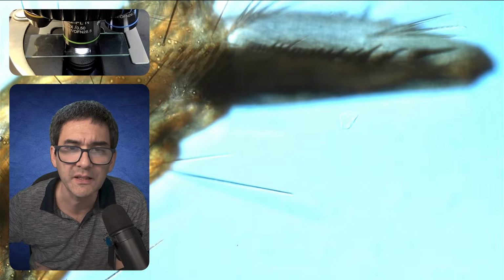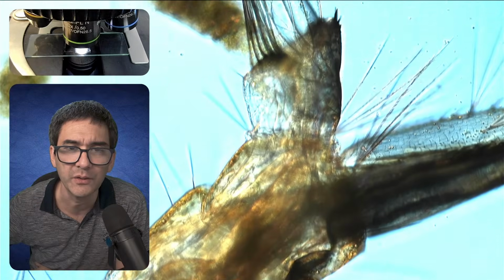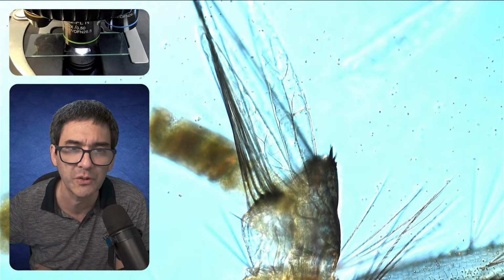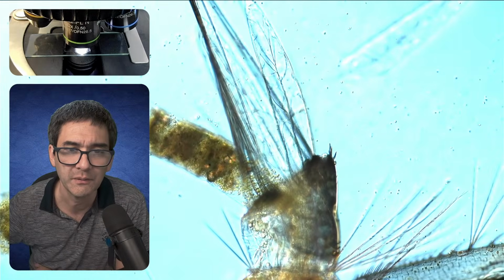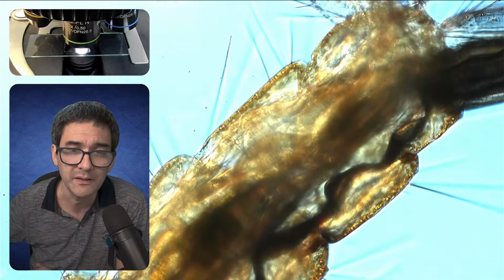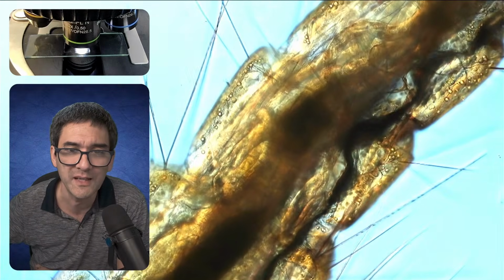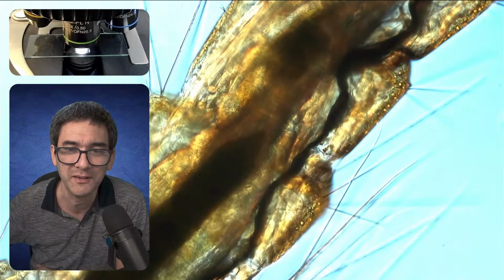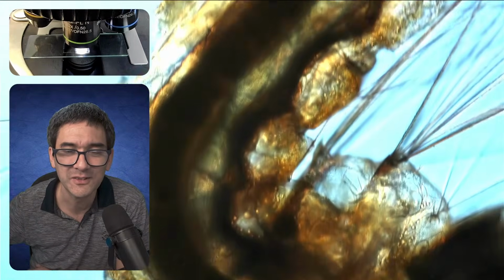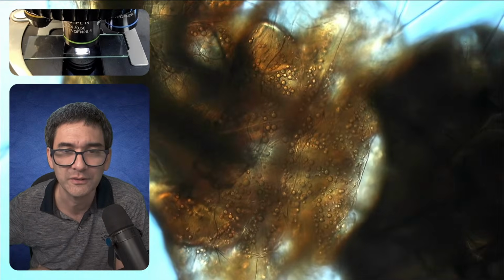To a certain extent, I know that these are not always very nice animals, nice under quotation marks, because they cause so many problems, at least if they are indeed mosquitoes. But in any case, I think under the microscope there is not only fascination but also a certain degree of beauty, under quotation marks. So quite interesting, the complexity of nature.